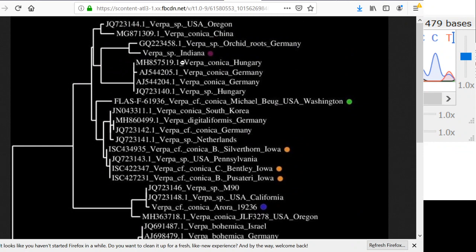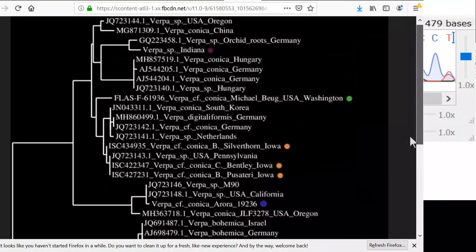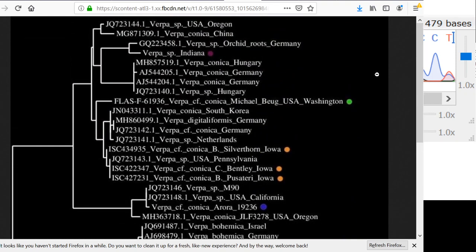So the ones that I made, I put one color on, and the ones that people emailed me, like the different people, I put different colors, so you know which color they came from, which person they came from, based on the color of the dot there. And that helps me see which sequences are from GenBank and which ones I actually have the specimen available. So you can also see that I put the names on here. And so what I did is I wrote a program that looks up each record in GenBank and puts the name, puts the country, the location, into the FASTA file. And that program is available on GitHub in case anyone wants to use it.